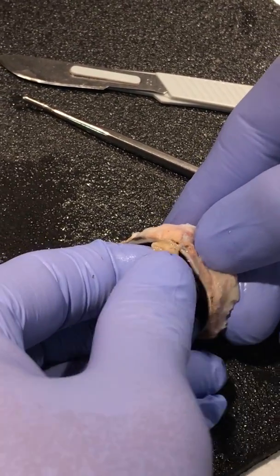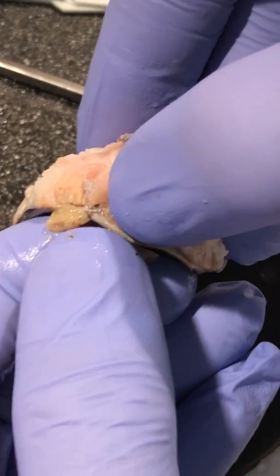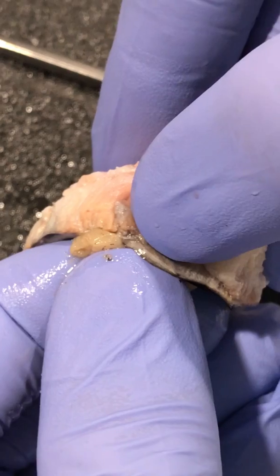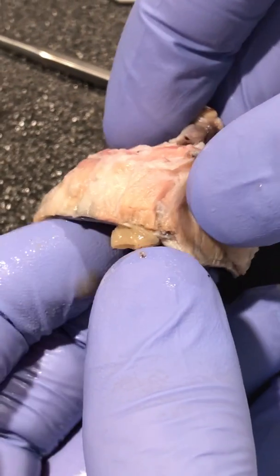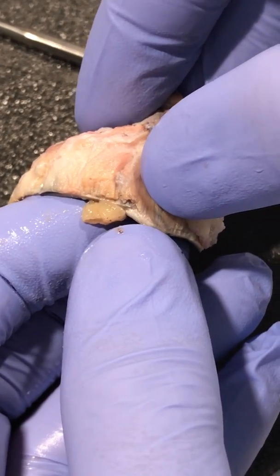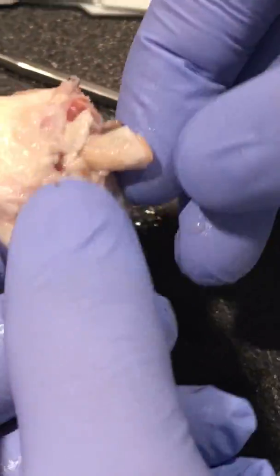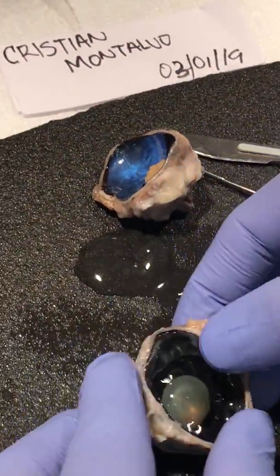Then after that layer, there is something I want to expose here. If you get close, it's the part in between my fingers. That is called the sclera. It's the white part of the eye, and its main function is to provide structure and protection to the eye. Okay, and then after we've seen this part, we're going to go to our second part, which is the front of the eye.